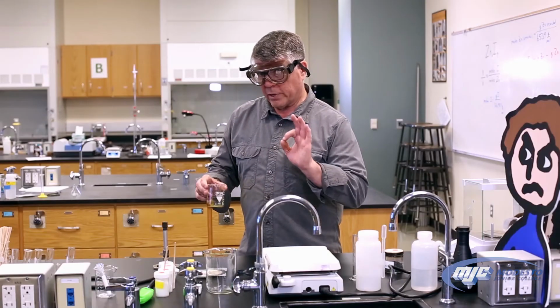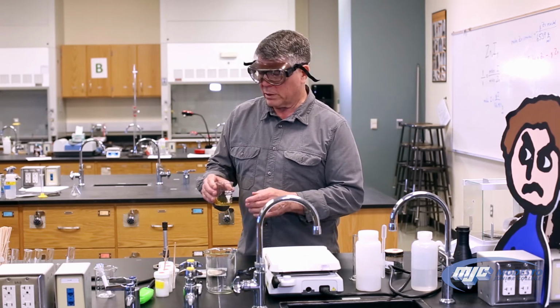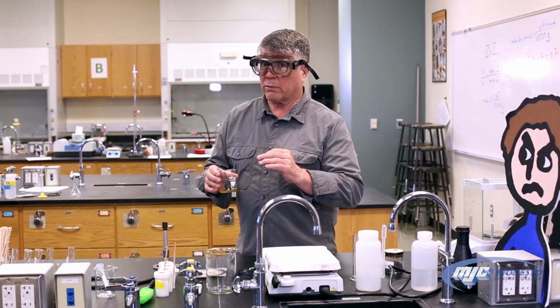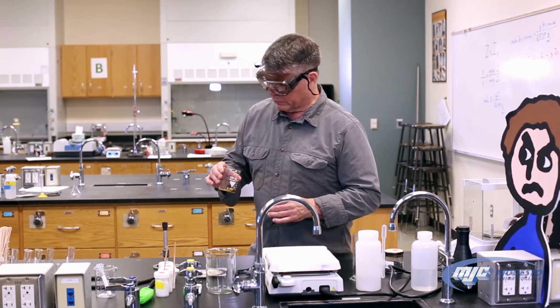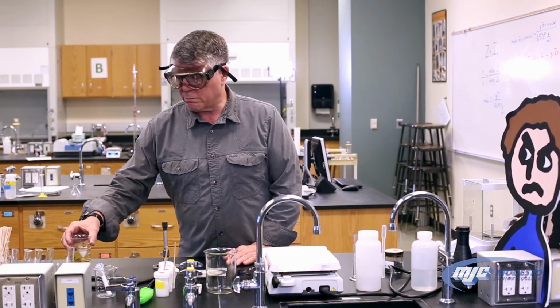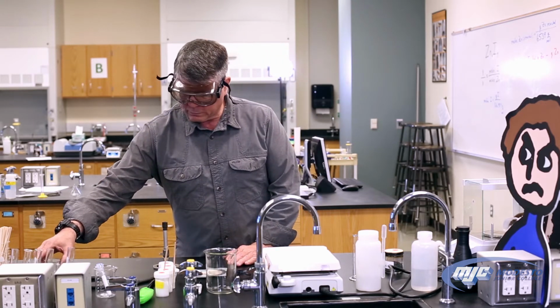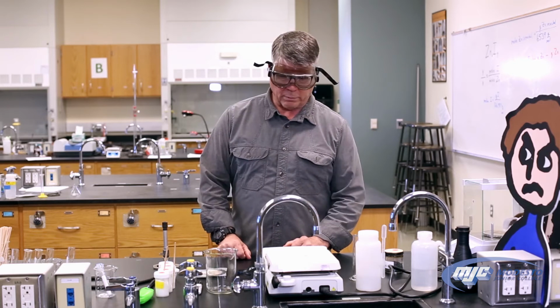And so our test to make sure that all the iodine has actually reacted is we put this on a piece of white paper, and if we see even a hint of yellow, that means it's not quite finished and we want to let it go a little bit more. So we're going to set this aside, and we're going to pick it up every minute or so and just give it a swirl. So let's put it right here. Doesn't matter. Now we're ready to start the hydrate portion of the experiment.